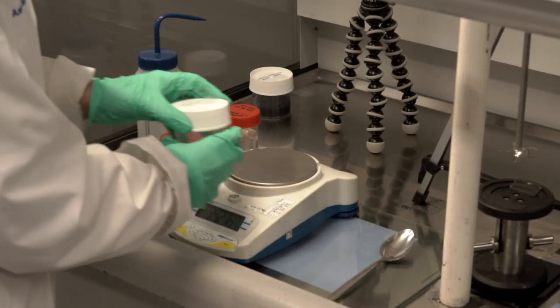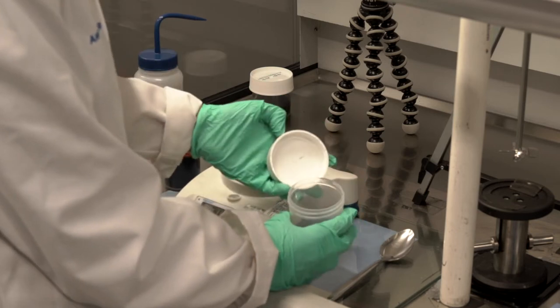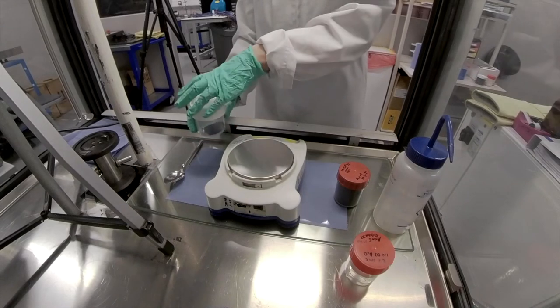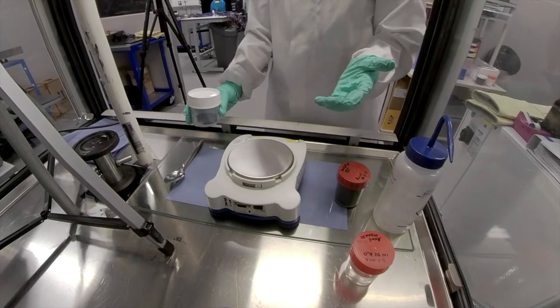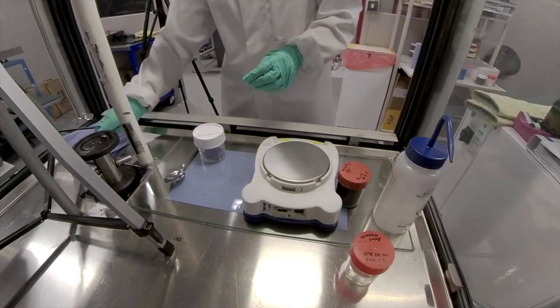Now that dry material floating on the top of my solution is really not sinking. And if I were to put it straight into the mixer, it would get thrown out of my cup. So unfortunately, I have to hand stir it first.